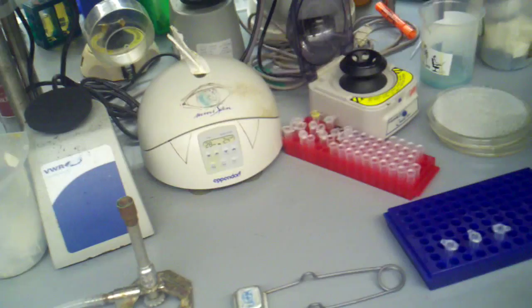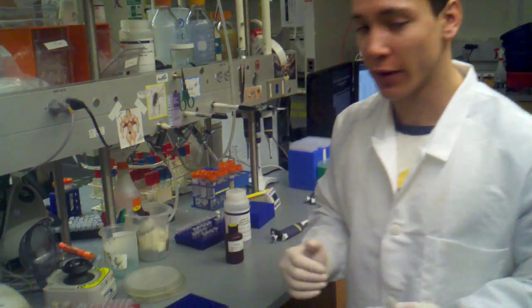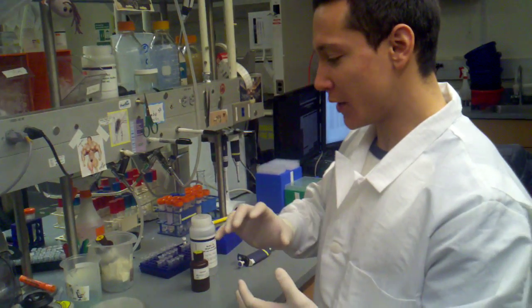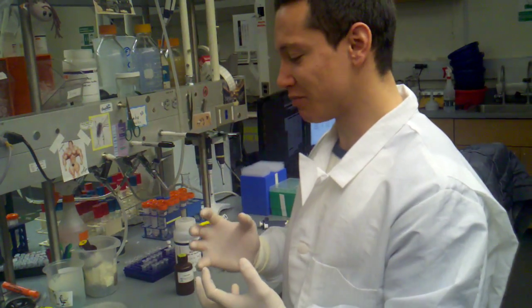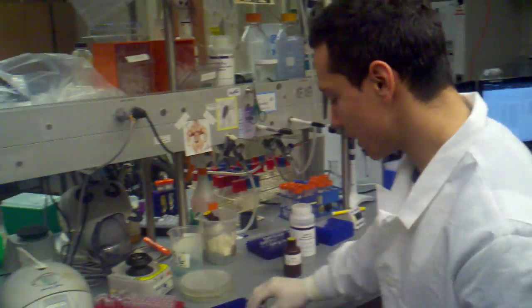And in a previous tutorial, I said you can get away with 15 seconds. You really cannot get away with 15 seconds whenever you're doing a gel purification, just because the liquid is much thicker, and there's so much more of it. So you really want to go for that full 30 seconds. I've had times where I've actually had to go like 45 or a minute just to get it all through if you have a very, very thick melting product.